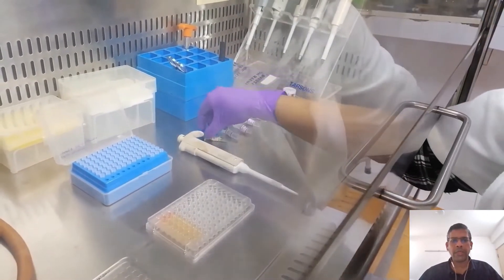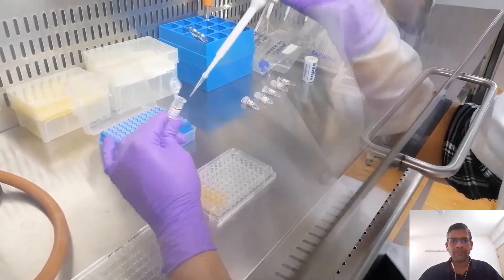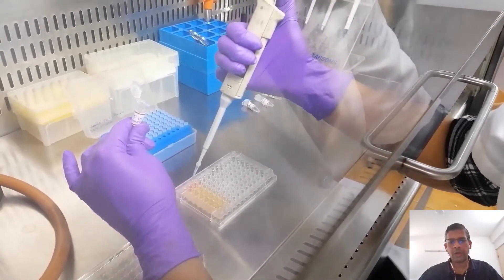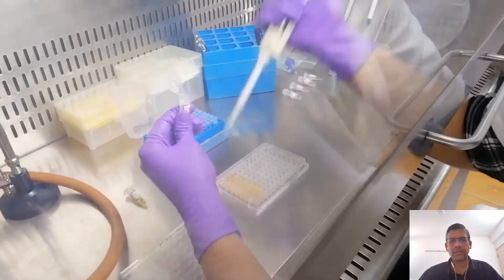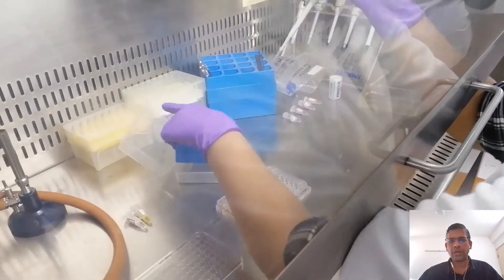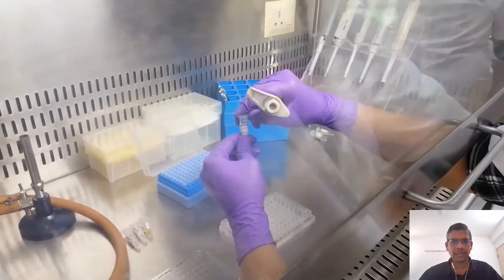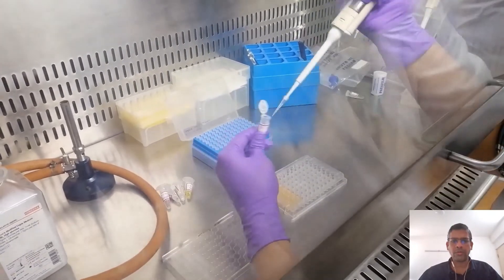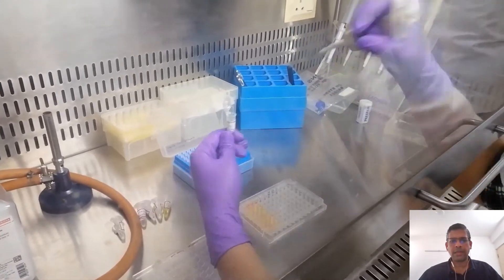After 24 hours of cell attachment, we begin the treatments. The blank wells receive nothing; the positive control wells are treated with Triton X100; and quercetin is added at different concentrations in different rows — all done in triplicates. After treatment is completed, the plate is incubated again at 37 degrees centigrade for 24 hours so the drug can take its effect on the cells.